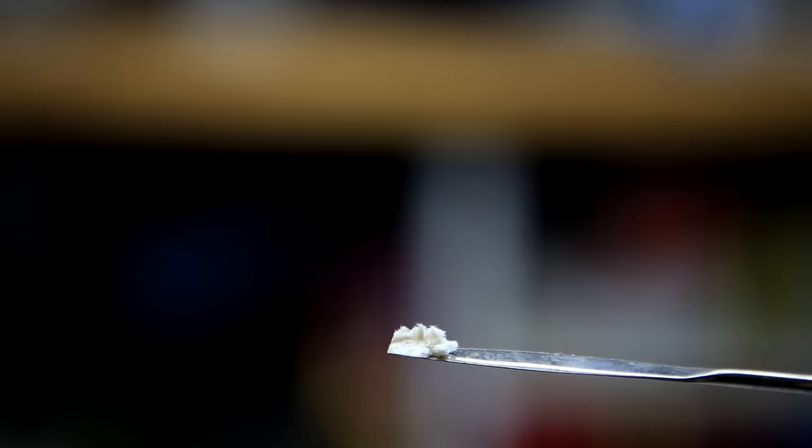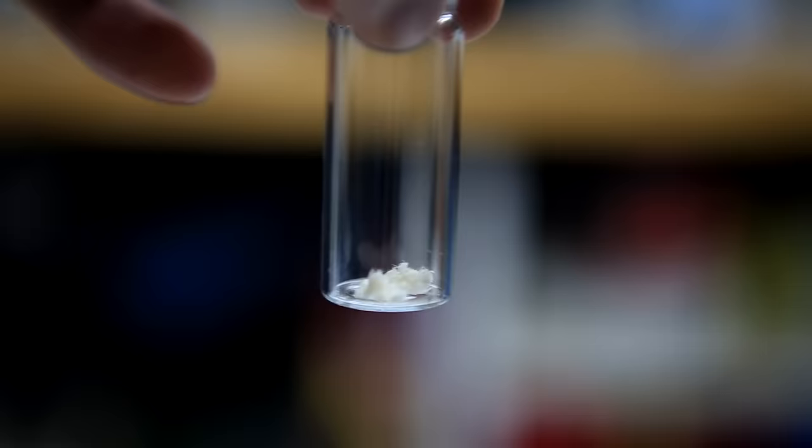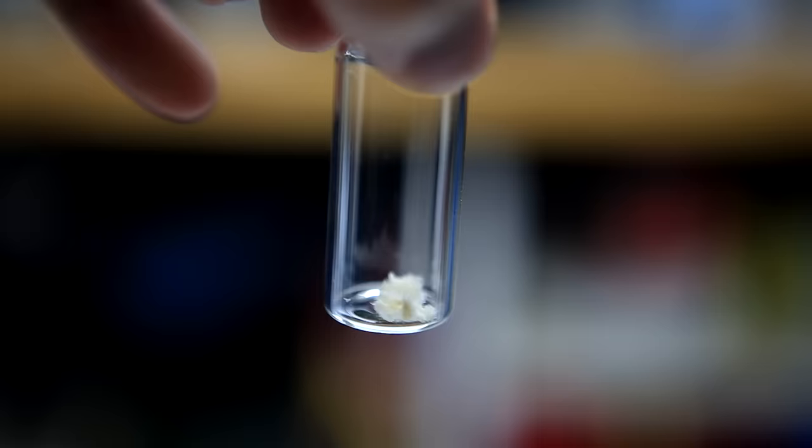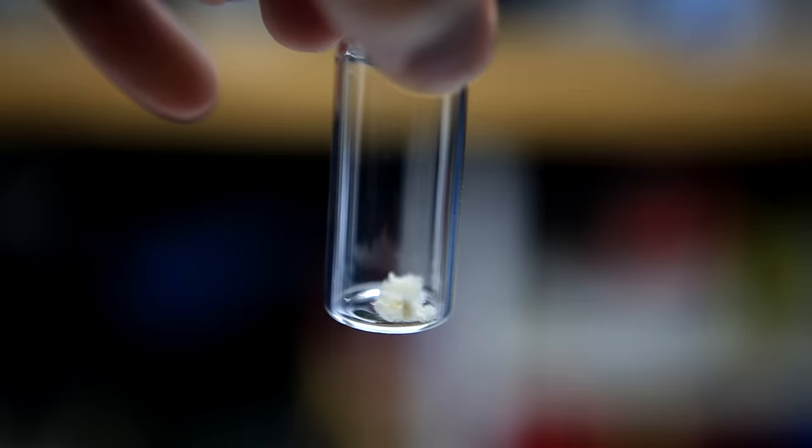In the end, the yield was 30 milligrams of nice white caffeine. I'm not actually sure why, but this yield is extremely low. It's honestly probably because my recrystallization didn't go too well, because as you can see before there was quite a bit of crude actually. But regardless of the actual reason, to make myself feel better about this terribly low yield, I'm just going to blame Folgers.